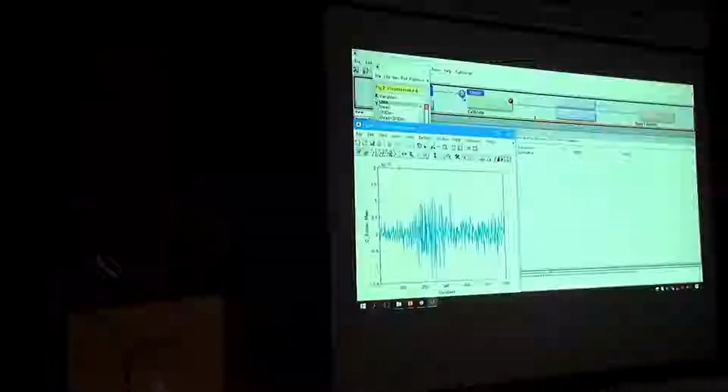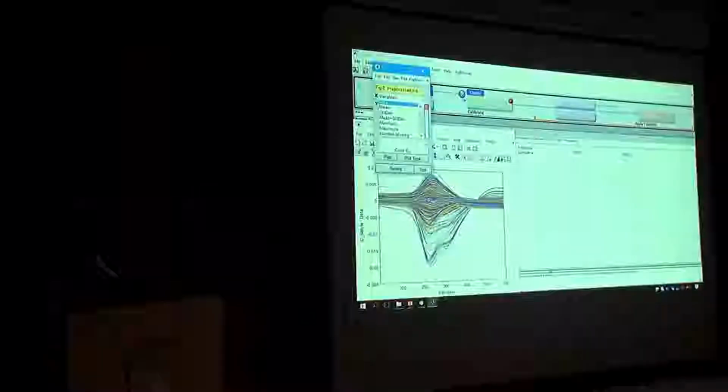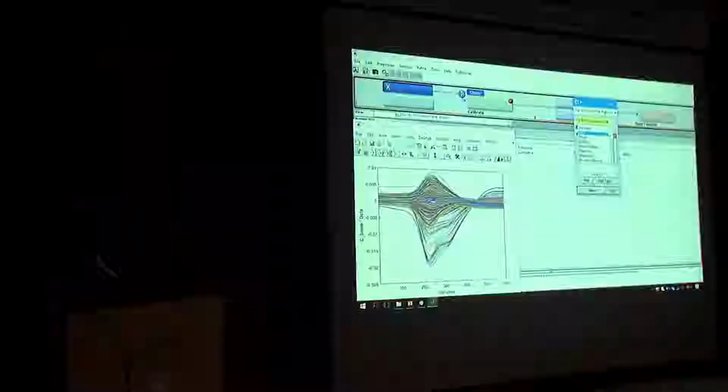How many principal components do we want to subtract from the perturbation? So let's start with 1, and then we can add to it. Because if you remove too much information, you run the risk of removing useful information. So you have to optimize that. First, let's visualize what happened to the data. Plot pre-processed data. We look at all the data. And let's color code it.